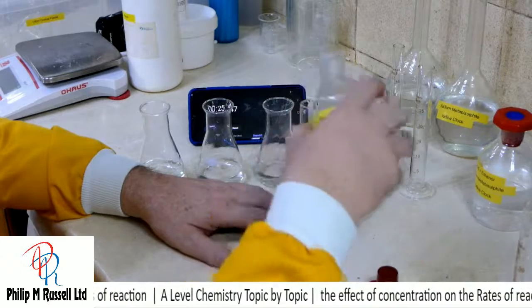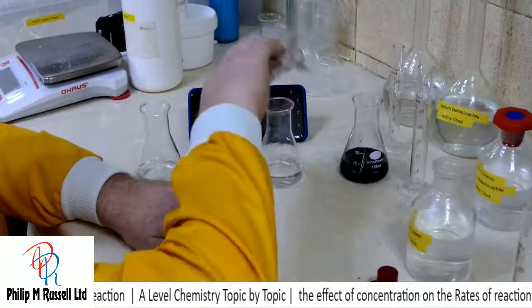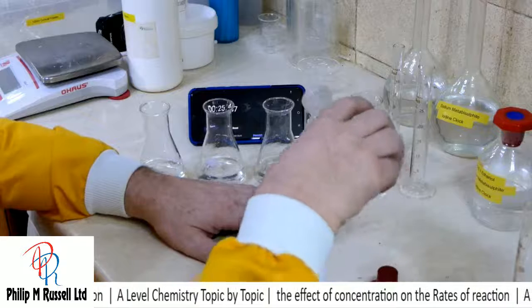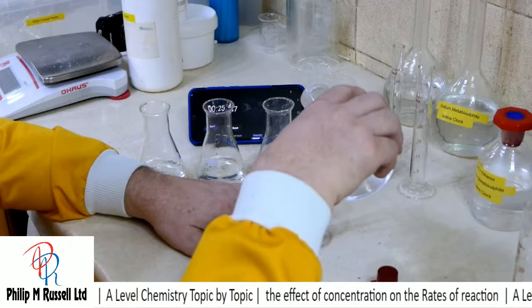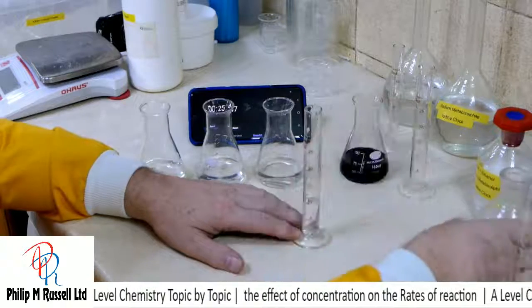If I wanted to be a bit more accurate with this, I suppose I could use a pipette to make this a little bit more accurate. This is only just using a simple measuring cylinder.